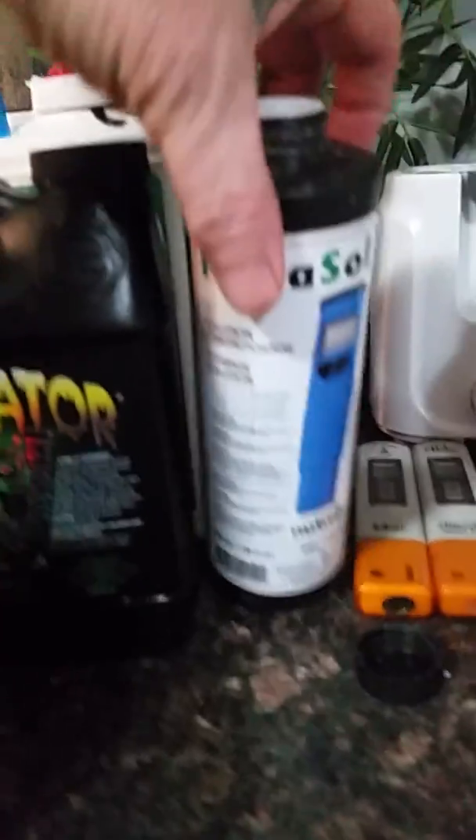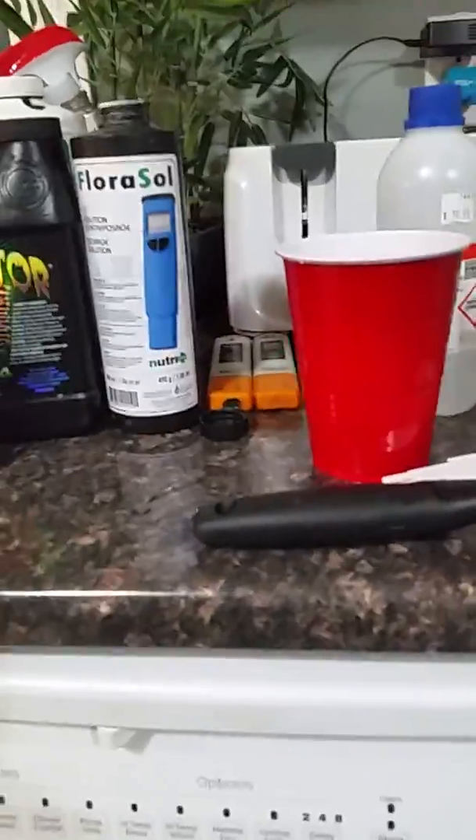As you can see, that solution sits at around 4.0 or 4.1. Don't let it dry out — that's all full of salt, just rinse it off, because that stuff dries out over time if you don't use it a lot. If you notice it dried out, put a little more in — it's only eight or nine bucks a bottle. Great stuff if you really want to get accurate.